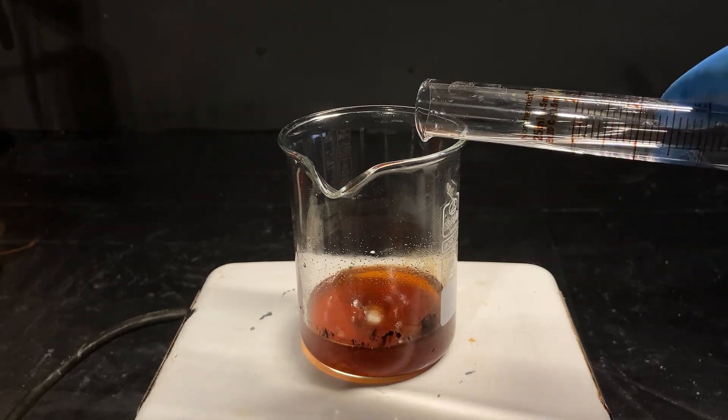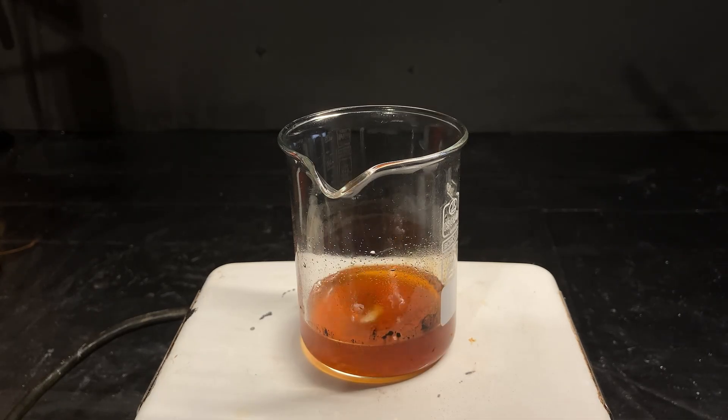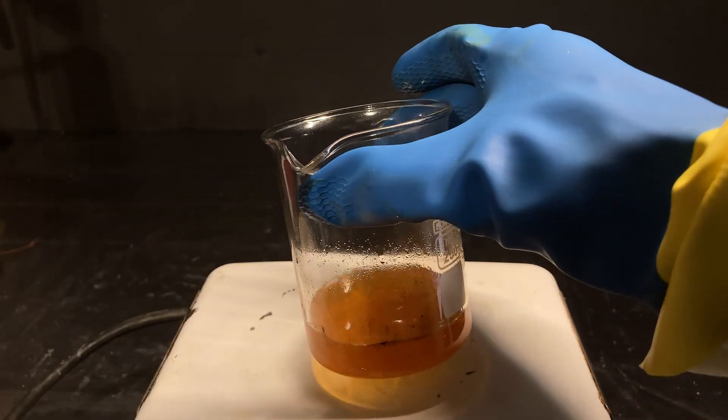Given enough time, the solution would clear up completely as if nothing had happened. It's also extremely hot and bubbles a ton.